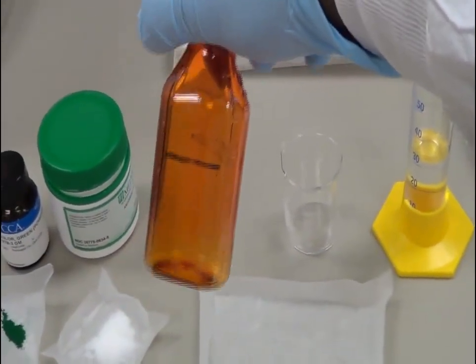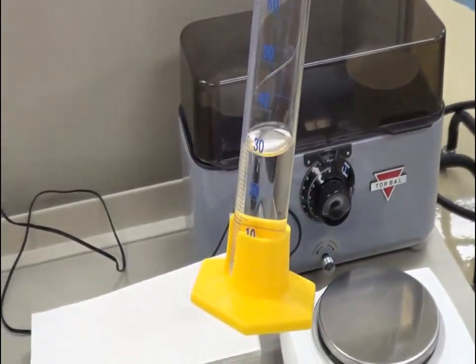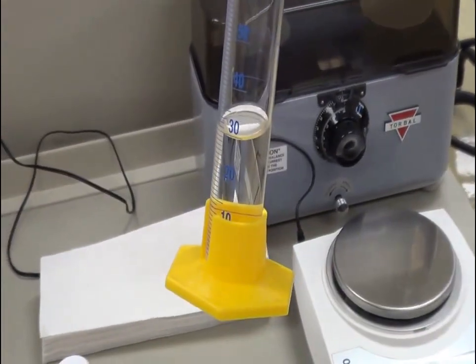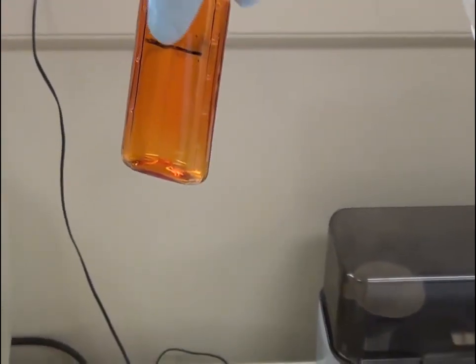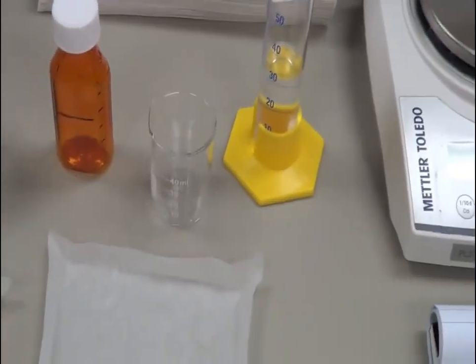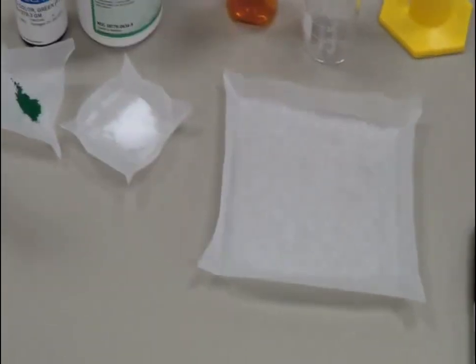I calibrated this bottle to 30 ml. To calibrate a bottle, you use a measuring cylinder with exactly 30 ml of water, pour it into the bottle, and mark it. We also need a beaker and a couple of weighing papers.